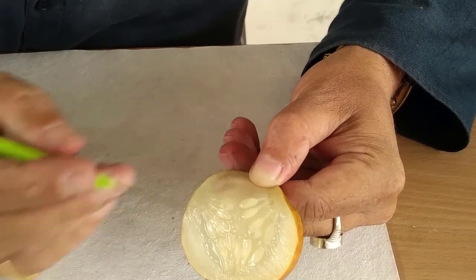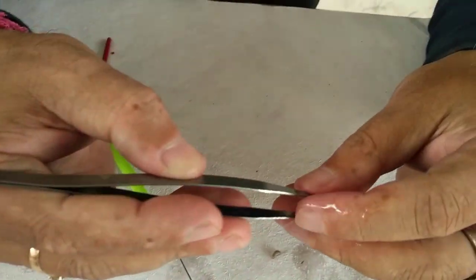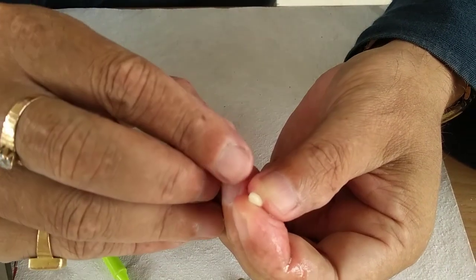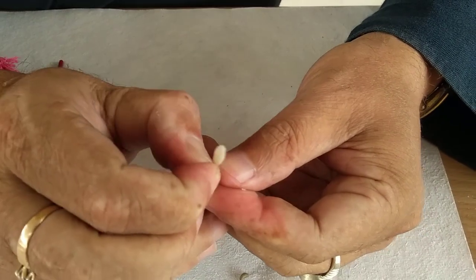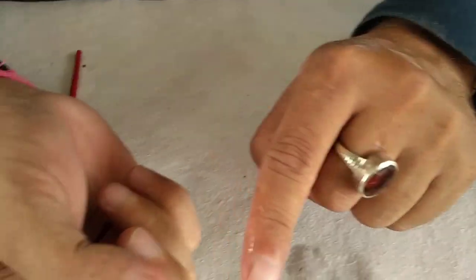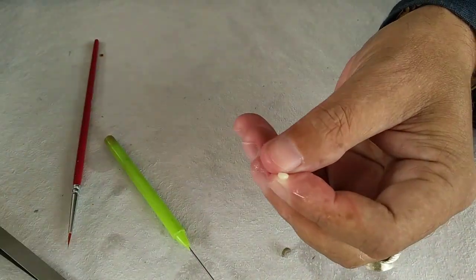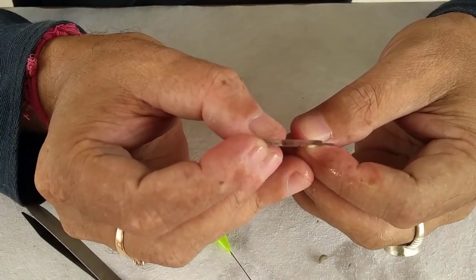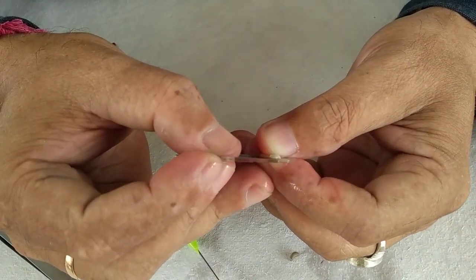I have taken out the seed. Now you hold the seed in your hand with the finger towards the pointed end and the blunt end on top. You just remove all the tissues from the seed. You can see the pointed end — micropylar end — and chalazal end. Now you take a blade and then you split open the seed.